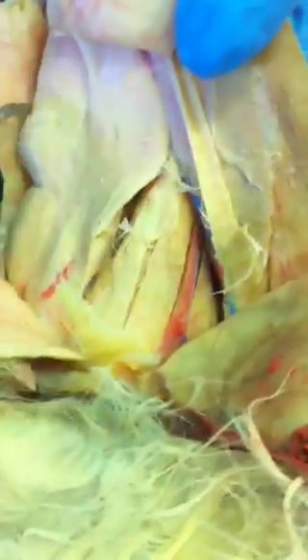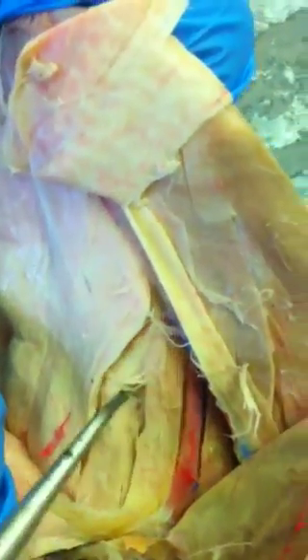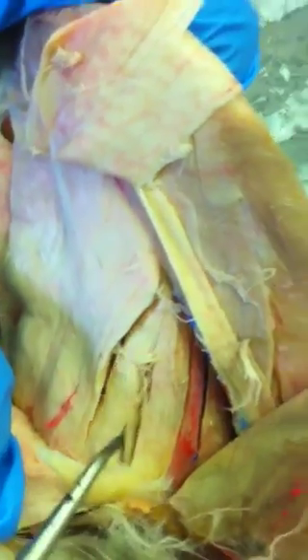This is the gracilis, this whole piece. And on the inside we have the adductor magnus. Then cranially we would have the adductor longus and adductor brevis.